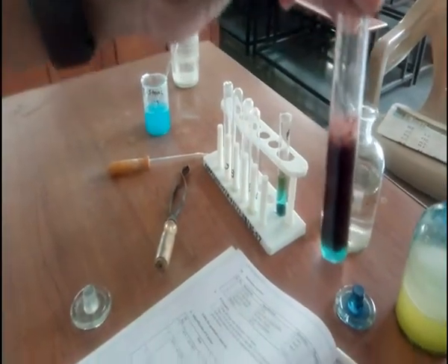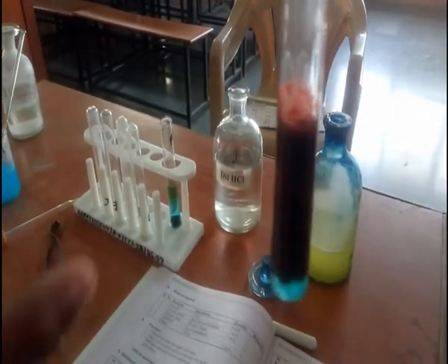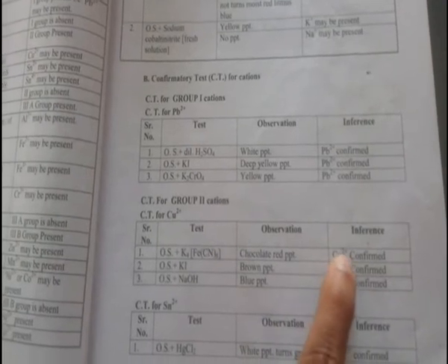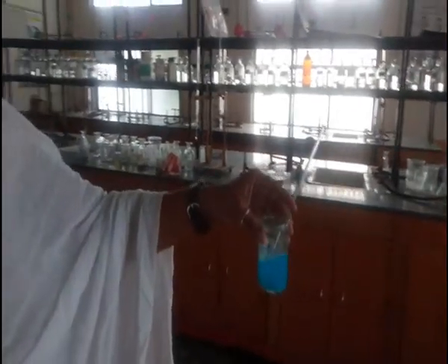Let's see our observations. In the confirmatory test we add OS plus K4[Fe(CN)6]. The observation is a chocolate red PPT — yes, this is the chocolate red PPT. The inference is that Cu2+ is confirmed. The cation present in our OS (original solution) is Cu2+.